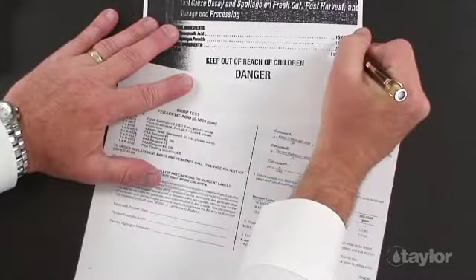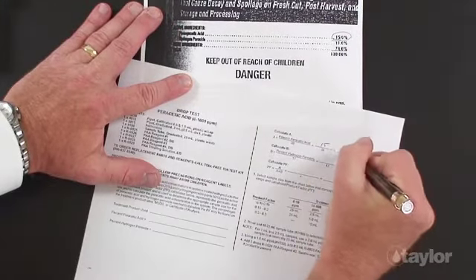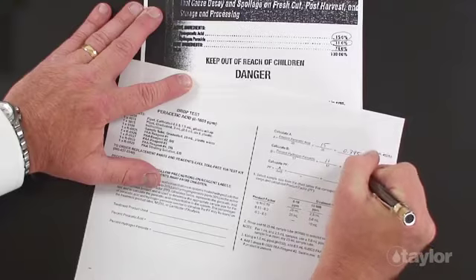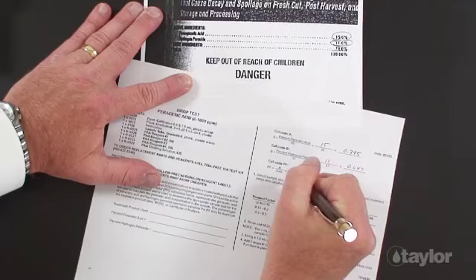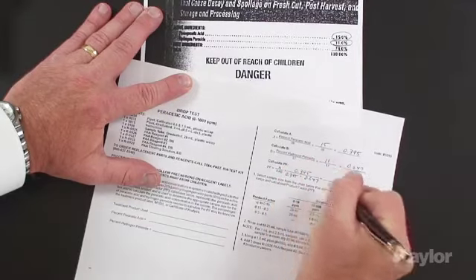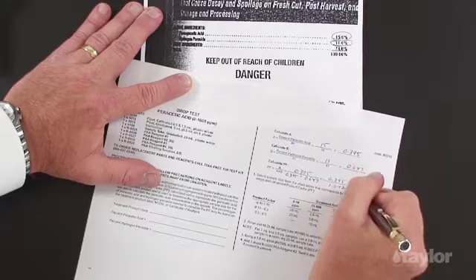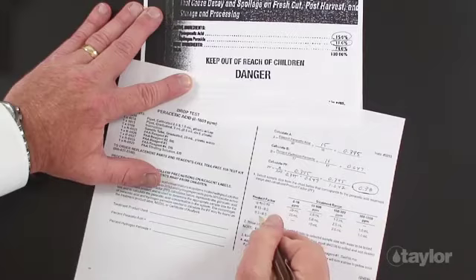To calculate factor A, divide the product's peracetic acid concentration by 38. Factor A equals 0.395. To calculate factor B, divide the product's hydrogen peroxide concentration by 17. Factor B equals 0.647. To calculate the product factor, divide factor A by the sum of factor A and B. The product factor equals 0.38.